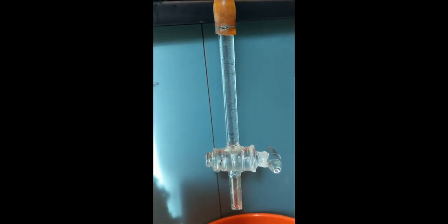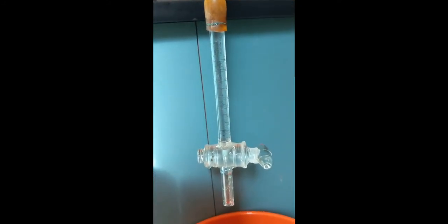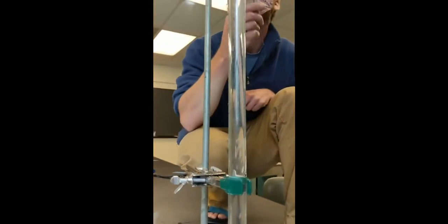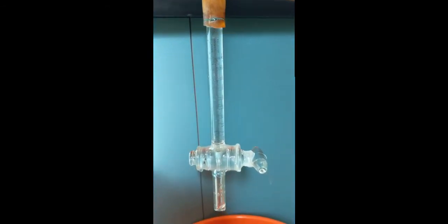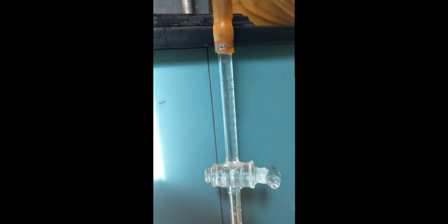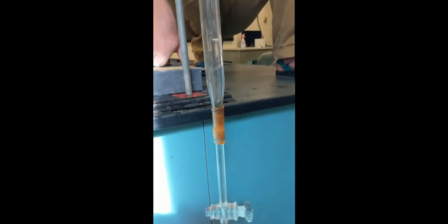The reason for this is that we have a very, very fine sediment sample here where the silt and clay particles are suspended in the water column and simply not falling very quickly. So even at 40 seconds, we still have very, very little, if anything, to measure down in our sample. We're going to have to wait substantially longer periods of time, 90 seconds and 250 seconds, for there to be any accumulation at the bottom.